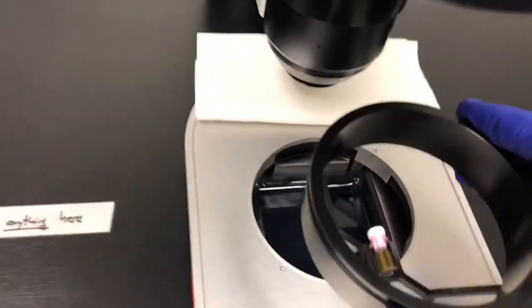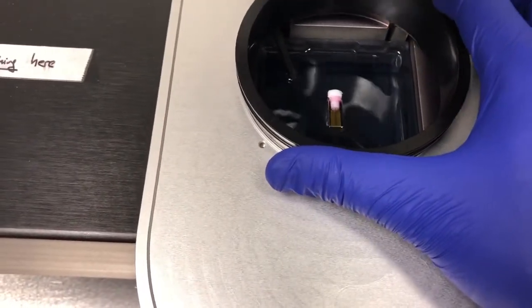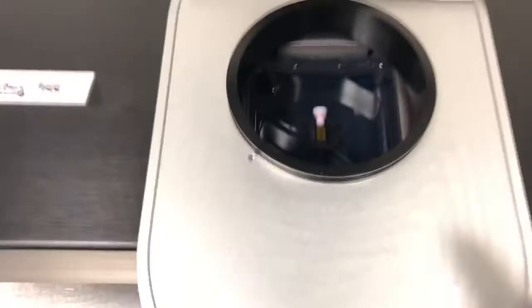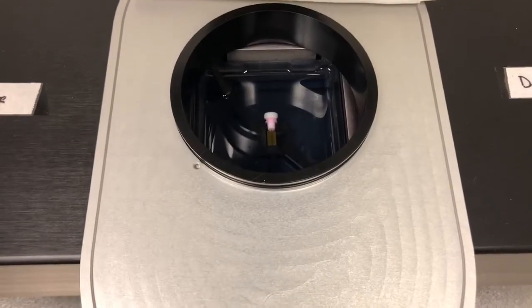Now this is going to go in the system. I'm going to grab this and go down gently. There. I've tried to place it as vertically aligned as possible. So now we're actually ready to start the alignment.